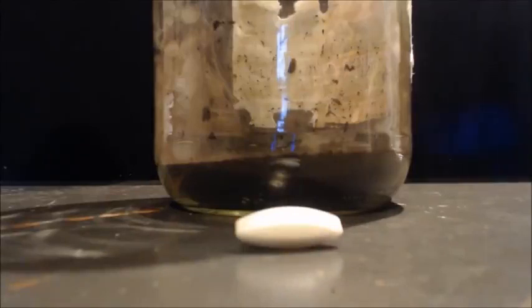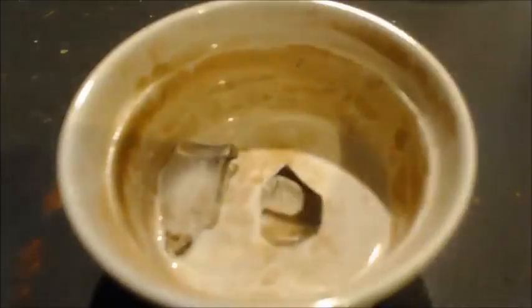But this next time, I'll decant it out, and then I will get the rest of the stuff out and put it in a vacuum filter, a frit filter, and put a vacuum on it, get it nice and dry. Then I'll put some more distilled water on it and suck it through again, get it nice and dry, and then I'll throw it on a plate to dry it, and I'll have nice pure MnO2. You can see I got the MnO2 on the glass and in the container itself.